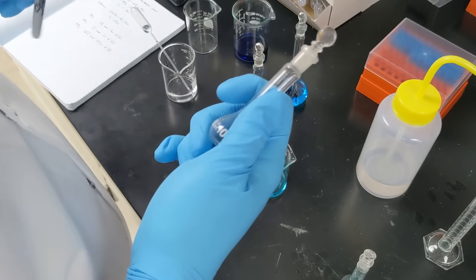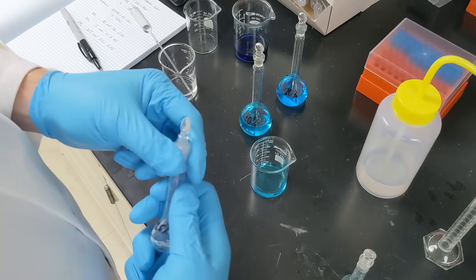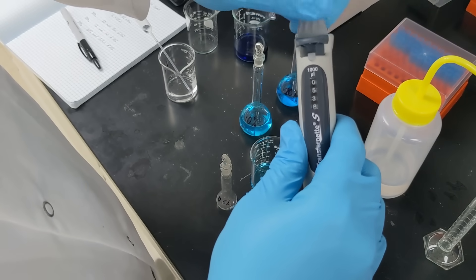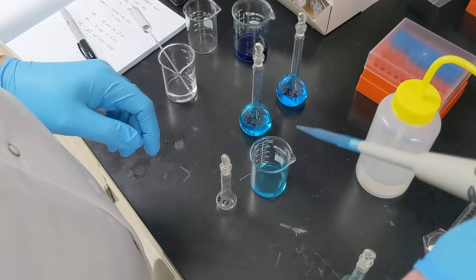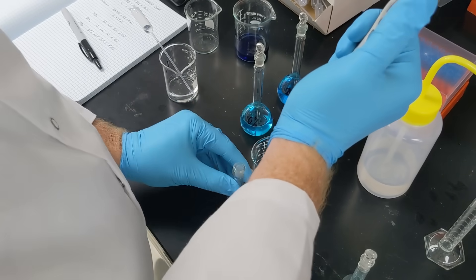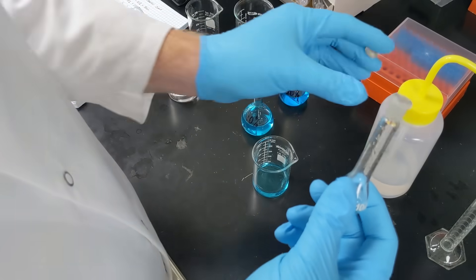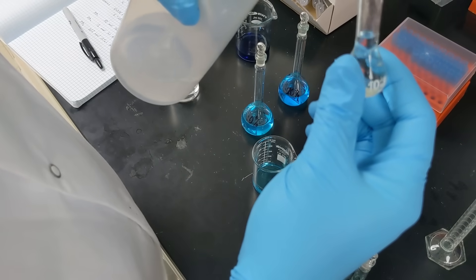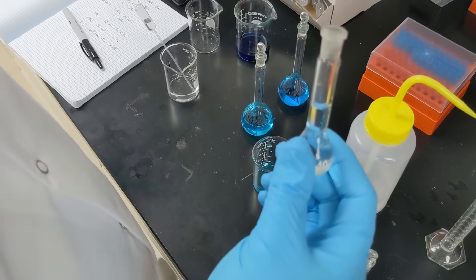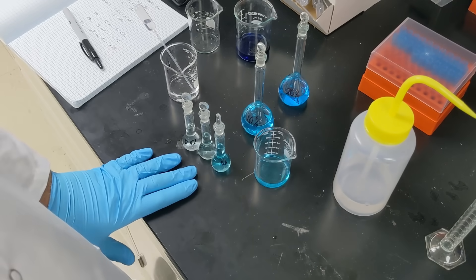Last is my 0.5% standard. I label the flask, adjust the same pipette down to 500 microliters, and lock it. Using the same technique — push to first stop, pull up, insert, push down to second stop, up, then down to second stop again — half a milliliter goes in. I top off close to the line with water, then use the transfer pipette for the final adjustment. From here I would get GC vials, use a transfer pipette to fill each one, and then inject onto the GC.